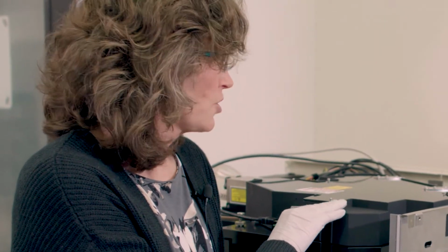You can have 2 forward scatters, and that is incredibly useful. Many customers use these systems to look at large particles such as blood, and they also look for smaller particles and constituents of blood, besides just the white blood cells and things. So by having 2 detectors up here, it allows the customer to have a larger range of things that they're looking at in the forward scatter direction.